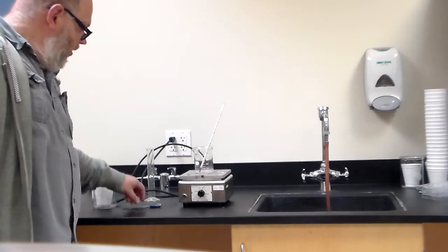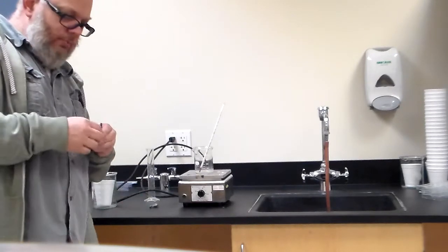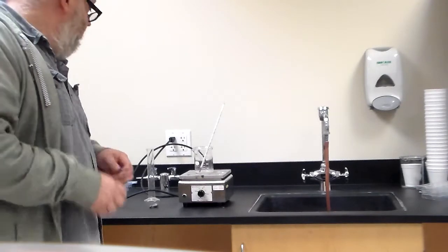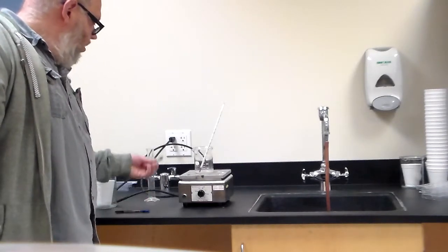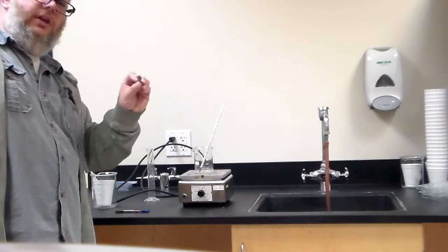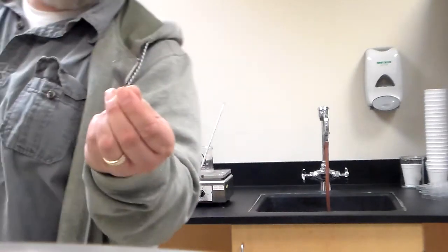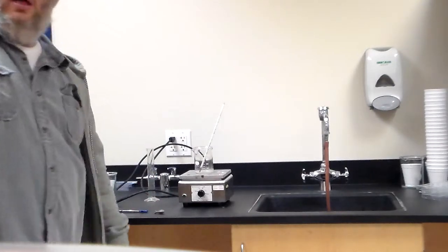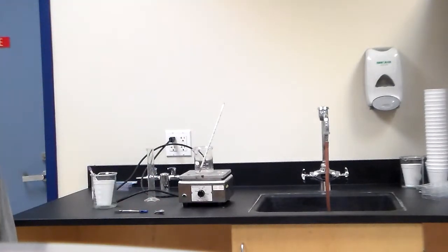So, we're probably going to have to work on a system for obtaining the metals, and I'm probably going to be the guy to do that. Now, I use this as an example. Here you can take a closer look. This is a lead weight. It's used for fishing. That works for what we're doing.